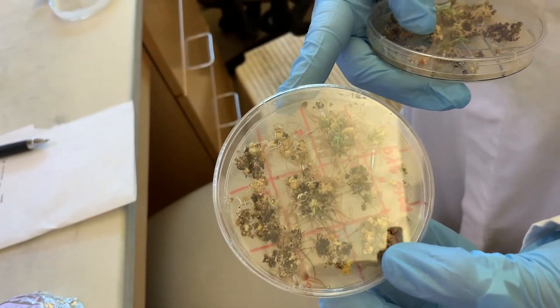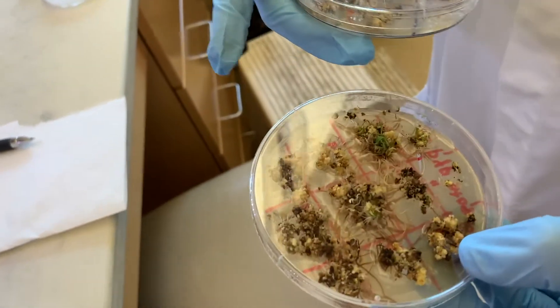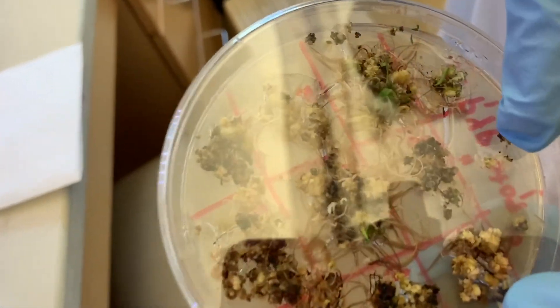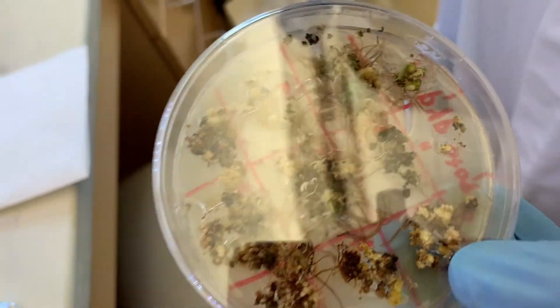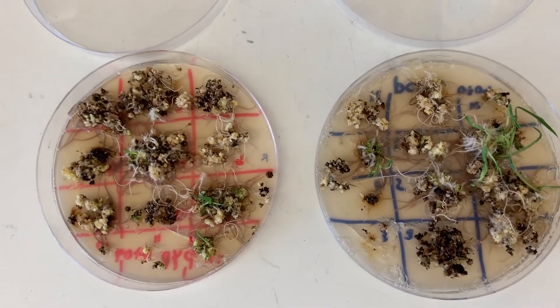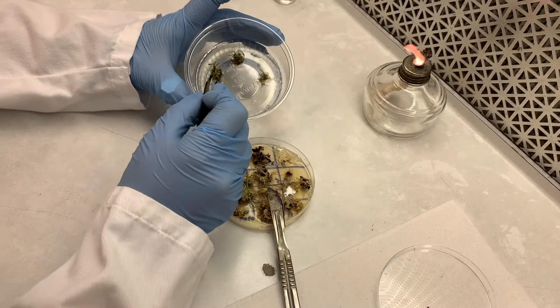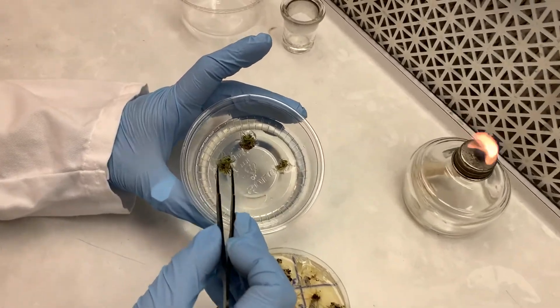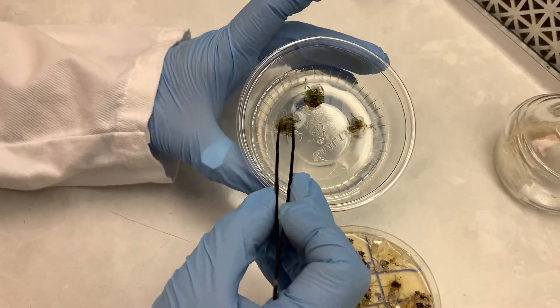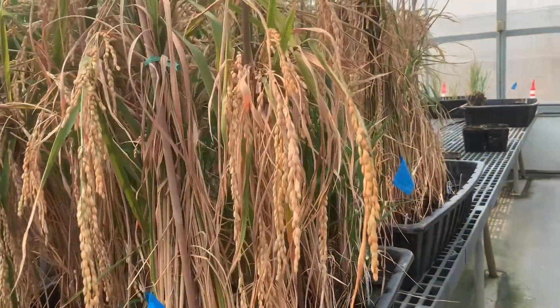After we finish the selection process, we continue with the regeneration, which is when the callus becomes a rice plant. This is possible because the media contains a combination of plant hormones that will induce this process. The regenerating shoots are finally moved to a medium that allows roots to develop, and then the plant is ready to be moved to the greenhouse to complete its life cycle and produce seeds.